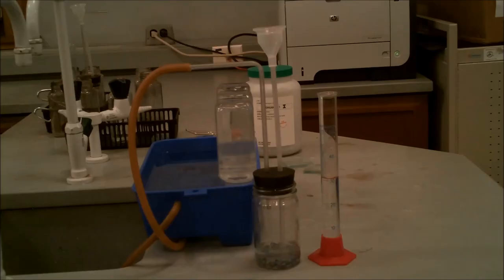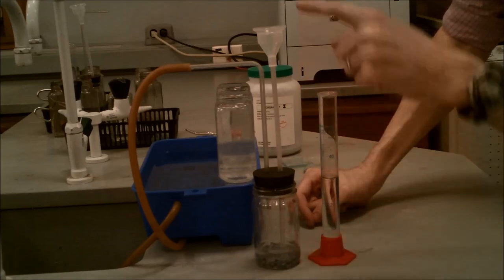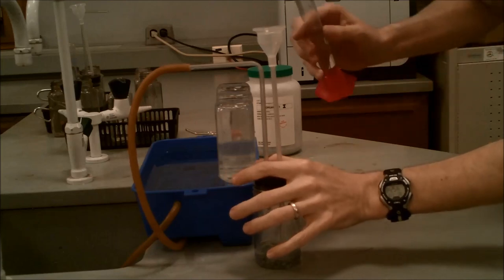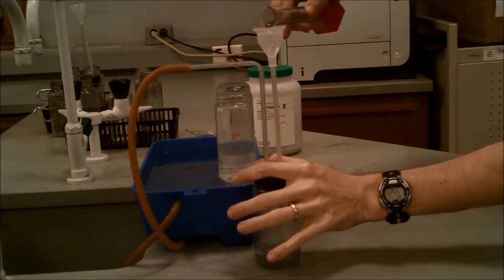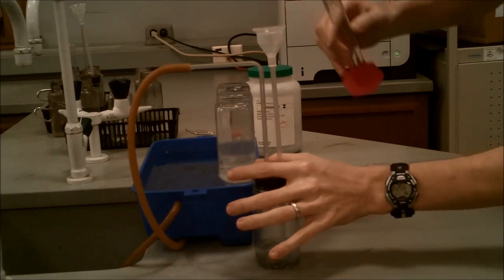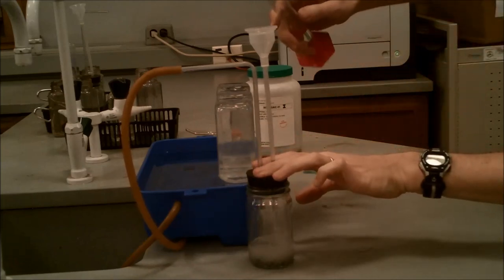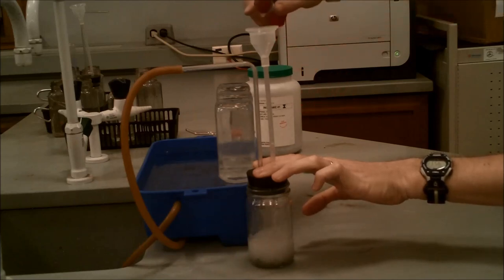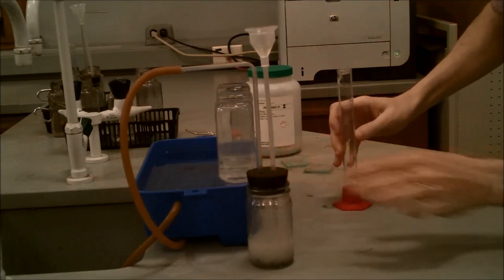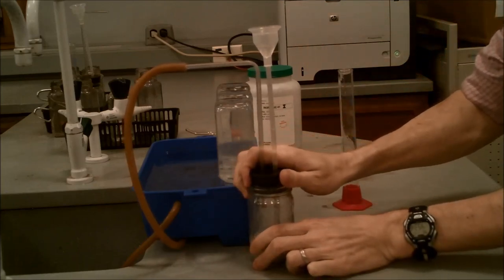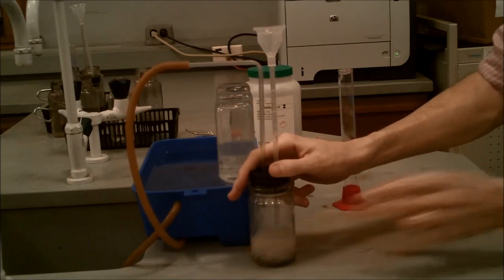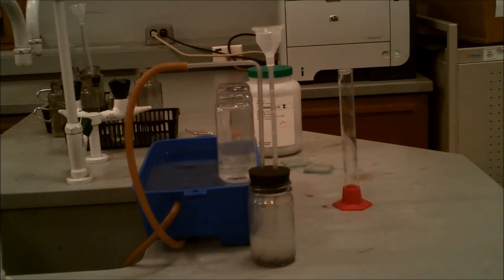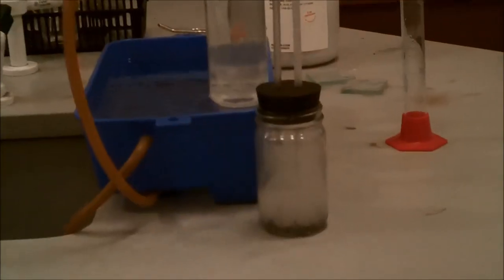Now we're ready to add the HCl. This is where you'll be making some of your observations, so you'll notice the camera moves around a little bit and feel free to move around the video if you like. So we have our thistle tube which is covered with the water. Our zinc is down there as well. Our thistle tube serves as a way to deliver that HCl directly to the zinc. And so we'll go ahead and pour that in slowly in small increments, about three to five milliliters at a time. And you can see once it gets in there that it starts to react with the zinc, it starts to bubble. The camera will zoom in in a second so you can get a closer look. Once all of the HCl is added, we will see that the reaction is going full go. If you have a little trouble getting the HCl down, you can always loosen the stopper to help get the HCl to go through the thistle tube. All the while making sure our plastic tube, the bottom of the plastic tube, is covered with a liquid and the glass one is not. So you can see all the bubbles being produced. All those bubbles are hydrogen gas.